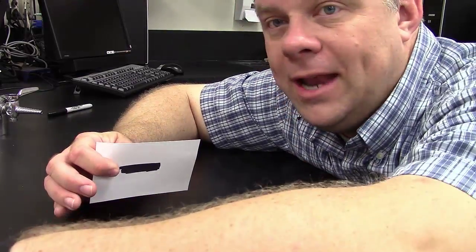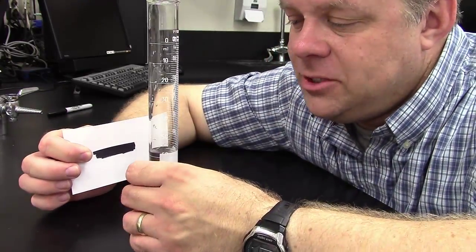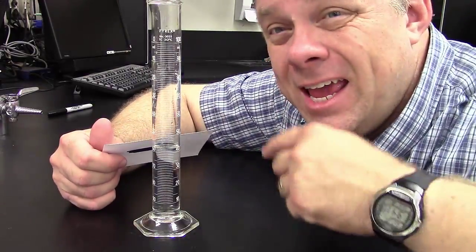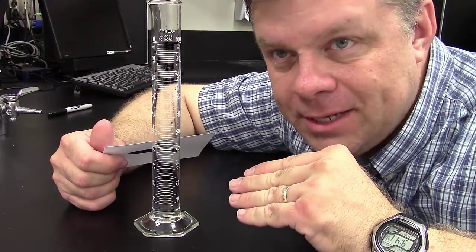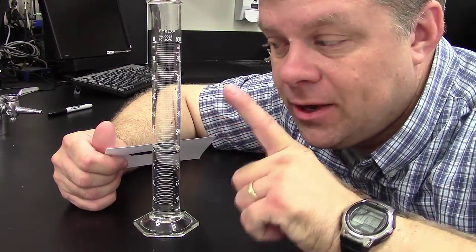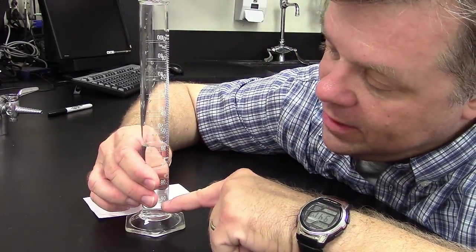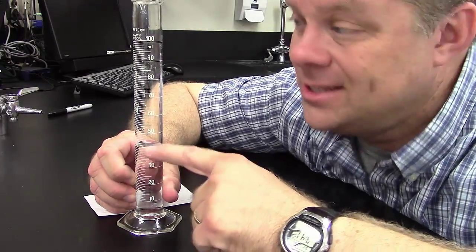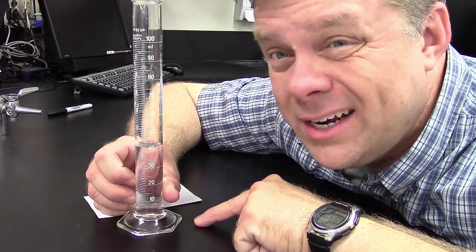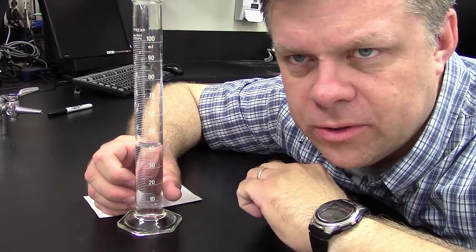So now let's say I'm going to the next one, the bigger one. In this case, I'm going to do the same thing, and this one is designed, now just be careful, there are actually two measuring units on this one. You see, sometimes you want to pour some out and measure it, and sometimes you're just saying, hey, how much is in there total? So be careful. It can be read both ways, so be sure that, for instance, this one should be on the smaller side because it's coming up from the bottom. So I'm going to read the one that says around the 40, not the 60, because 60 would have been coming from the top down, but we're going to go from the bottom up. Just make sure you note that. It's a good idea to take a picture of it too, if you forget, like, ooh, did I accidentally measure the wrong side? So just a little hint there for you.